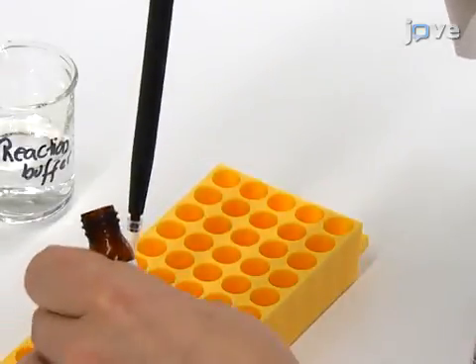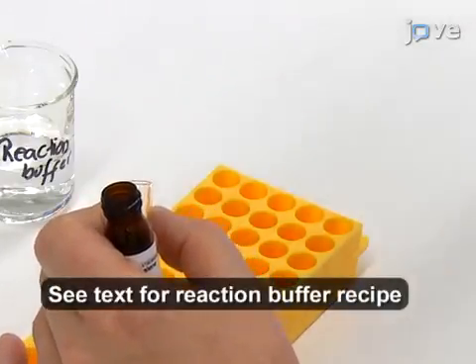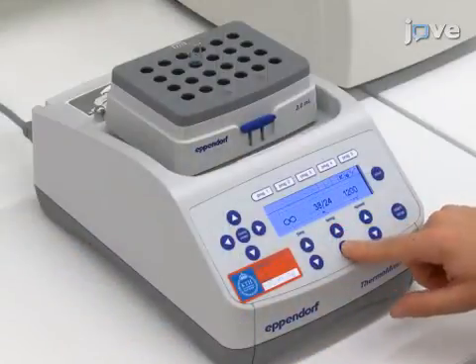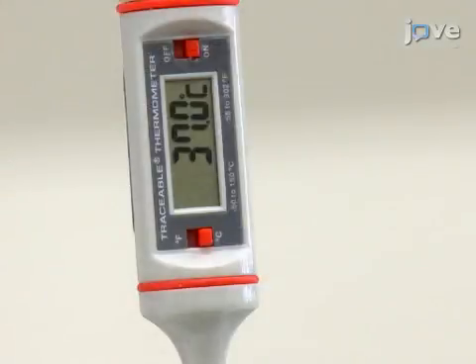Make a fresh 5 millimolar stock solution of substrate in reaction buffer. Obtain a homogeneous emulsion by ultrasonication at 30% amplitude for 2 to 5 minutes. Next, equilibrate a thermomixer at the desired reaction temperature. Verify the temperature inside a glass vial containing water by an external thermometer.